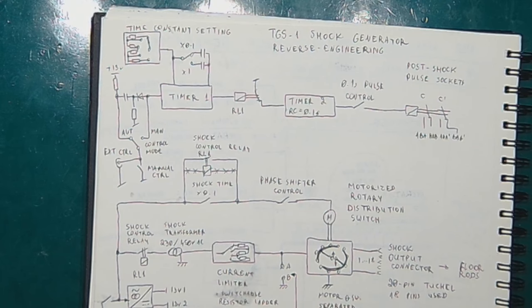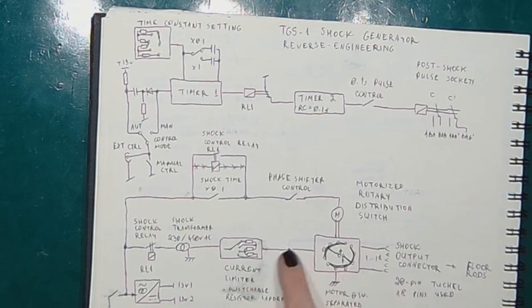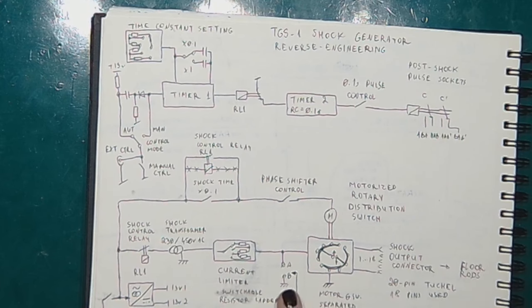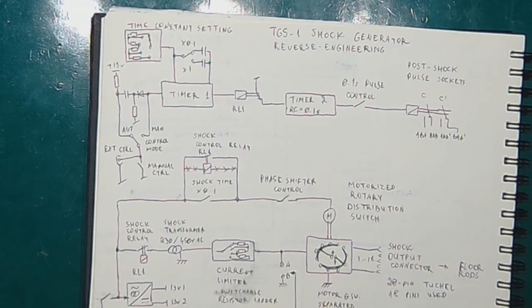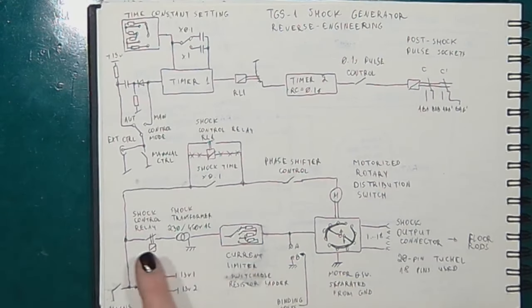Have I mentioned that the shock voltage is alternating rather than direct current? It is, because it uses AC without any rectifier and without any filter. So we've got this branch covered. What I also discovered was that it doesn't have the common ground with the whole device. Even though one of the sides of the distribution switch is connected with the motor, it's separate from the ground. It's placed on an insulating plate made of some phenolic. So we got this branch covered.